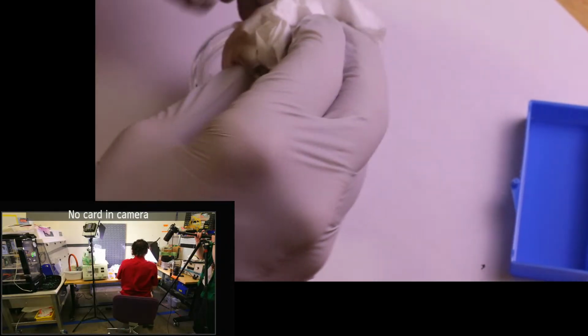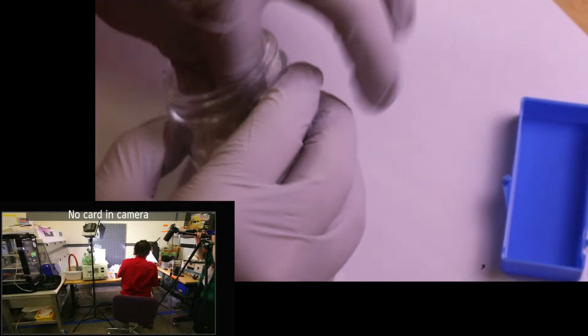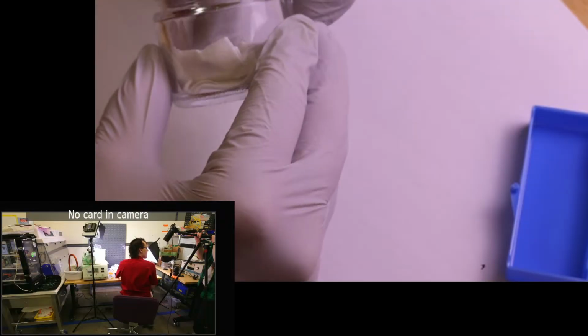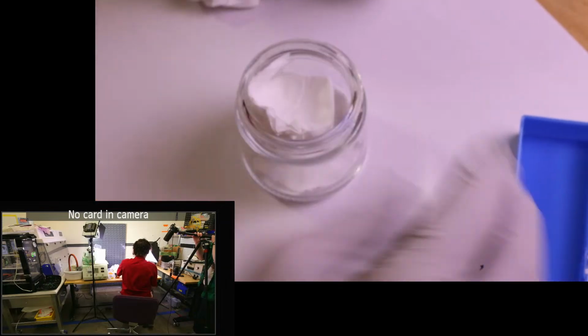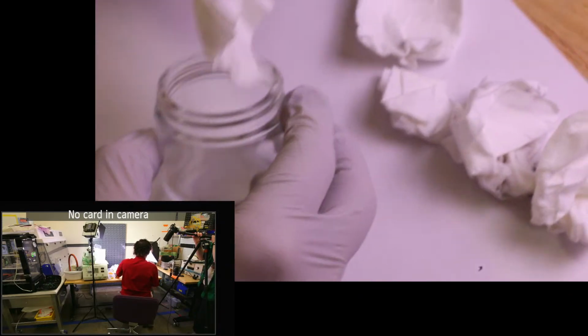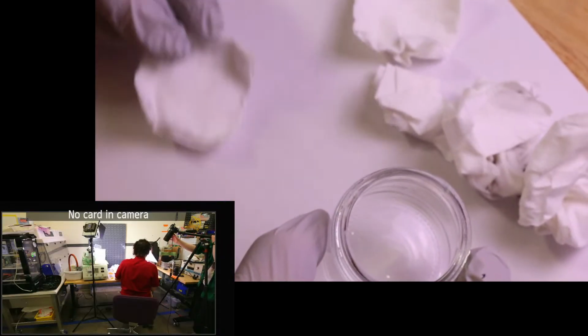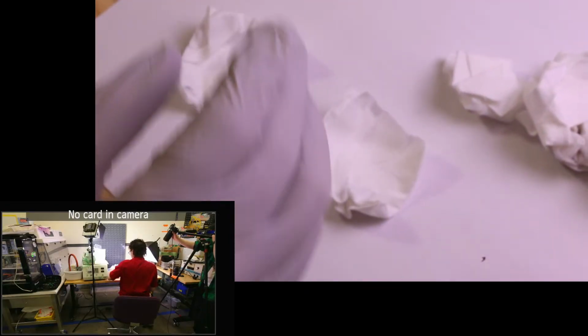So we're gonna go down to some of the lower ones that are in here, because those first ones were really what had all of our metal shavings, right? Does that sound good to you? Mm-hmm. Cool. Okay, so we'll lay these out sort of in order. Okay, so we got our very first one here. I know I folded that one up, and I think the first two really had some good pieces in it. Set that off to the side.